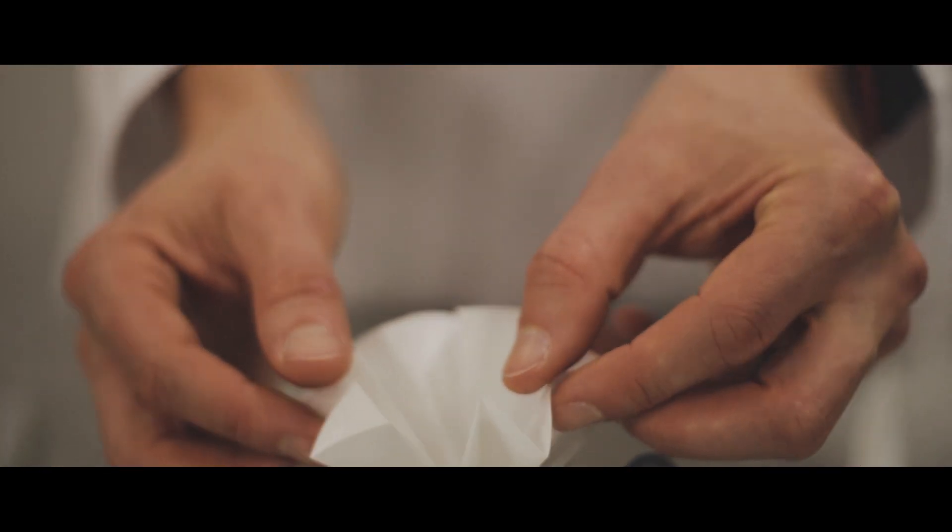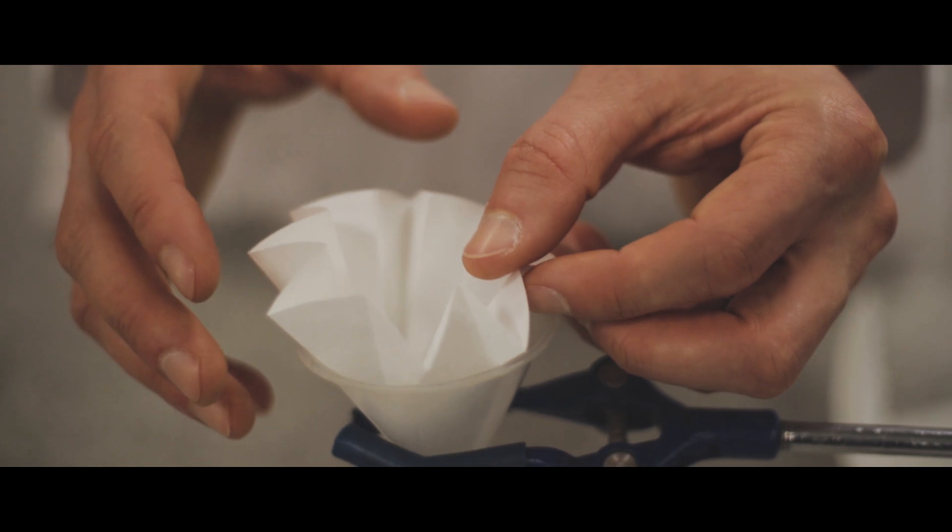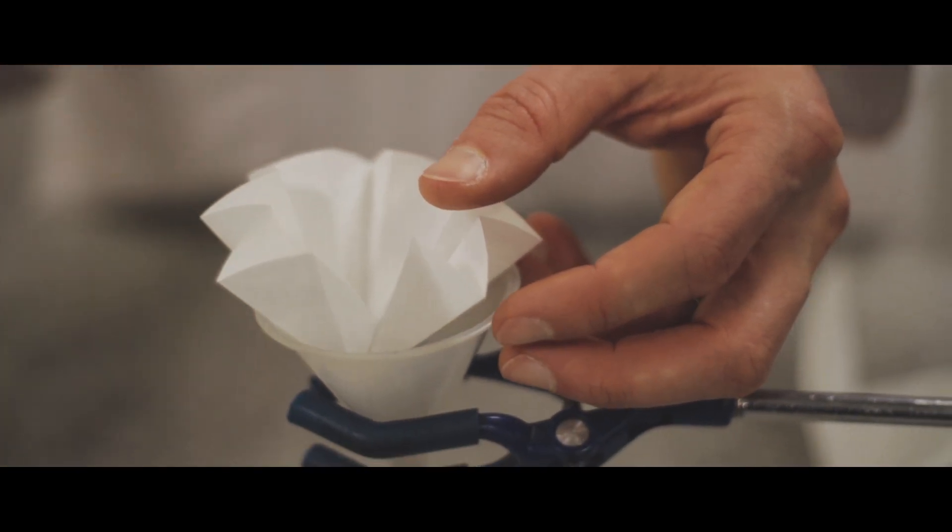So we can fold it in this way to increase the surface area and therefore increase the rate at which it filters.